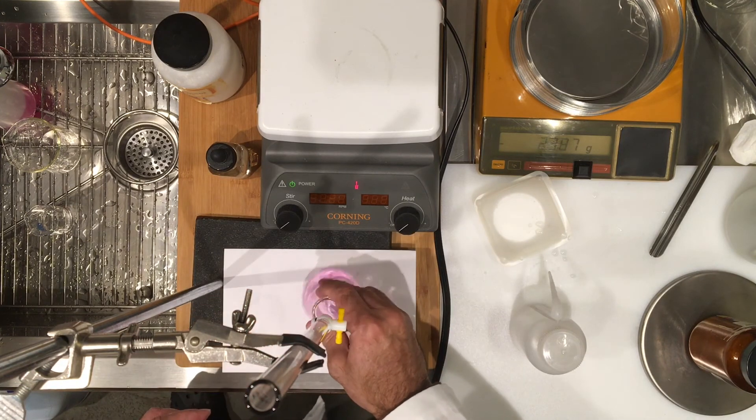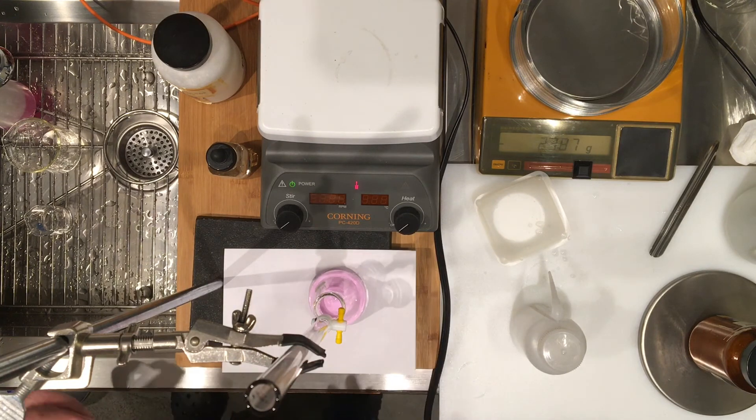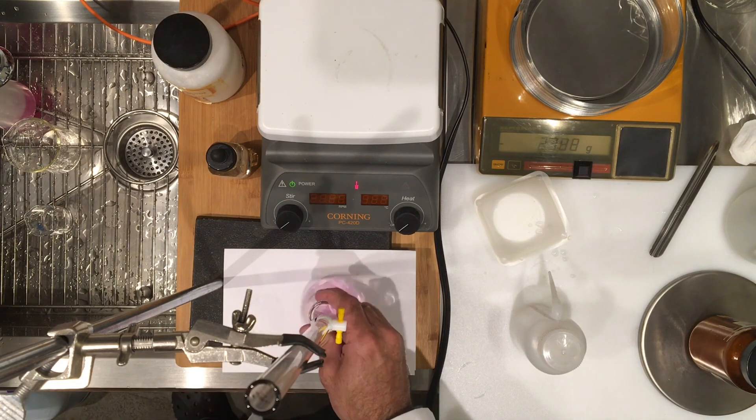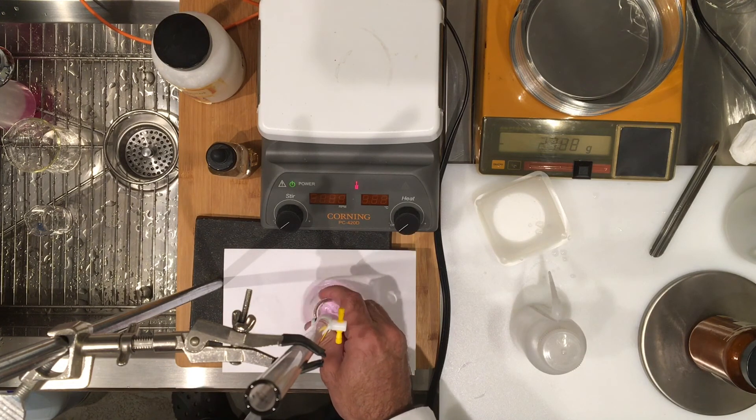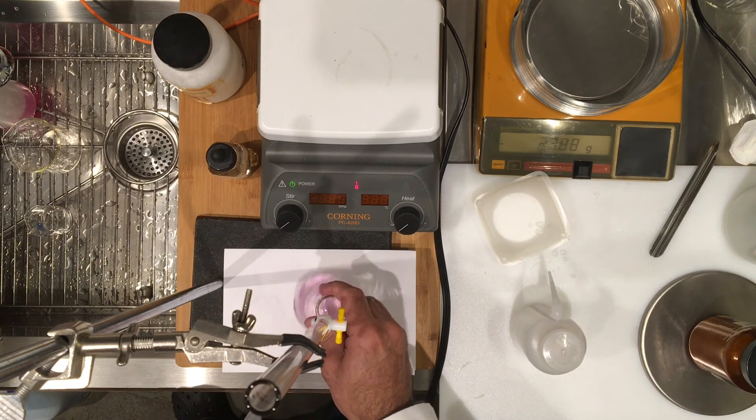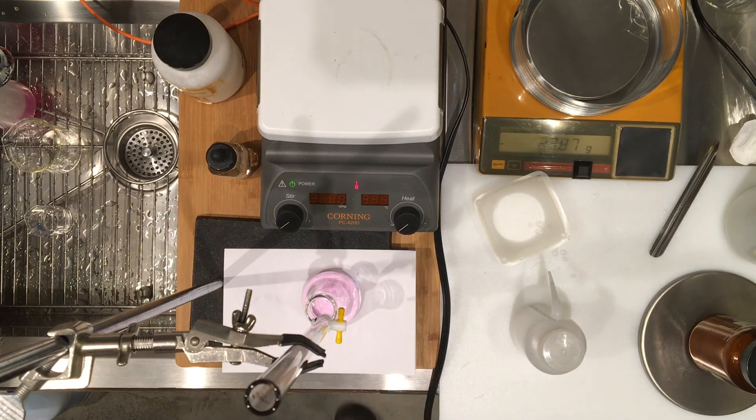There's one full drop again. You need to make sure that the color stays for maybe a minute or so, otherwise there's undissolved KHP in there. Remember I sort of poured everything in. Okay, there you go, so this works.